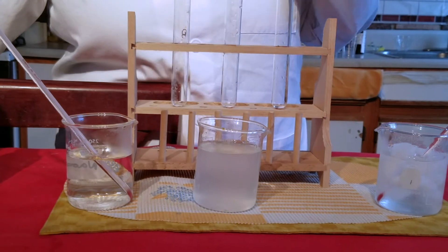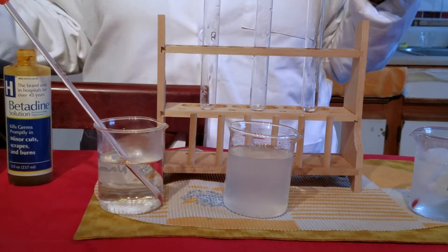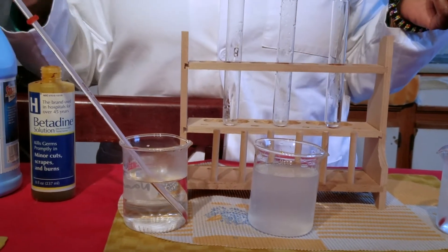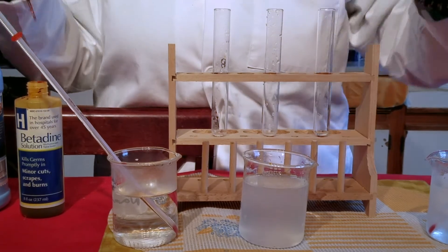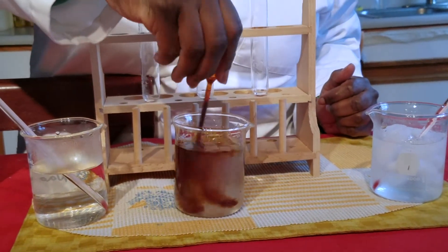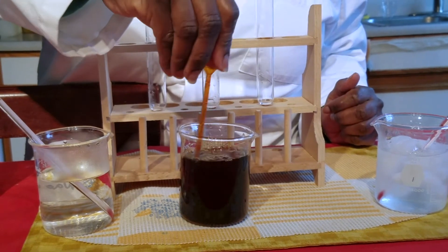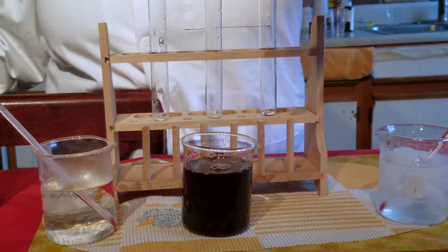Now, if you recall from biology, one of the ways to identify the presence of starch in a substance is to add some iodine. So to this solution we're going to add a few drops of iodine and stir. This makes a dark blue solution.